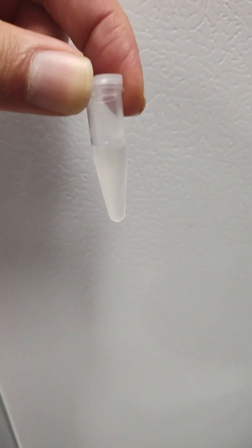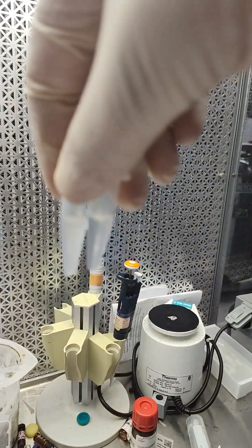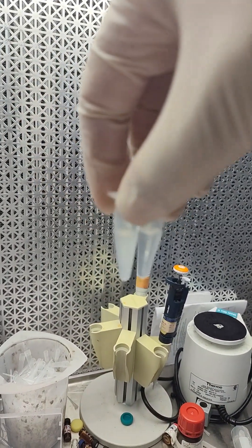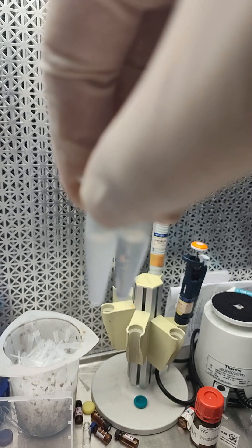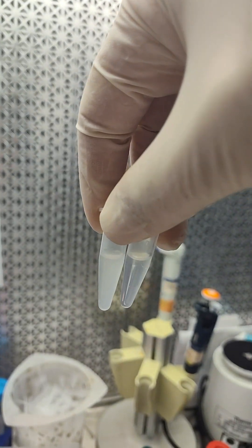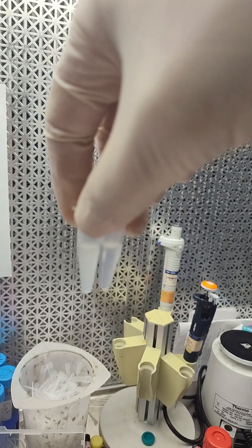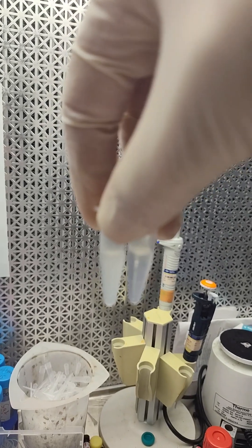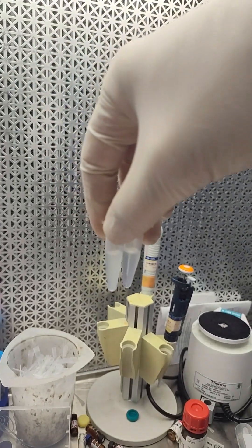Alright the Wendy's first. Got kind of clear looking. I think we're going to have to put these in the fridge. The first big difference. Off the centrifuge the Wendy's on the left you can see is still very cloudy. The McDonald's on the right has like a grease layer on top. It's very clear. But it's not cloudy. It's clear. It's still kind of cloudy on the left.